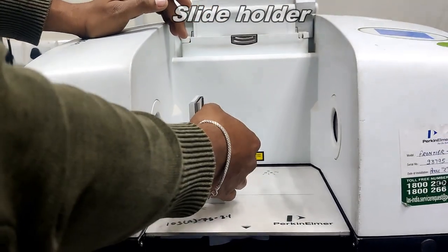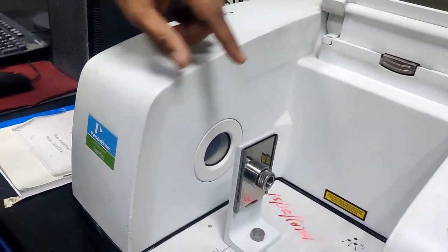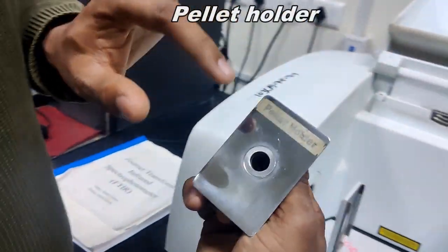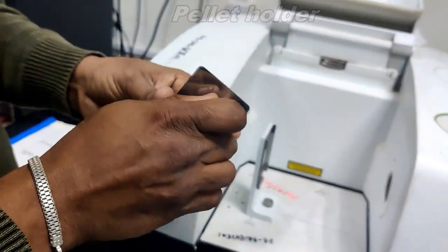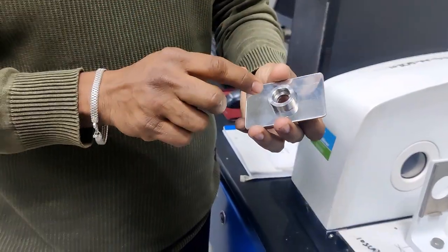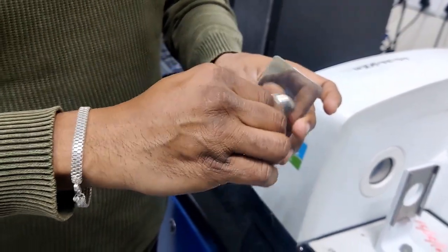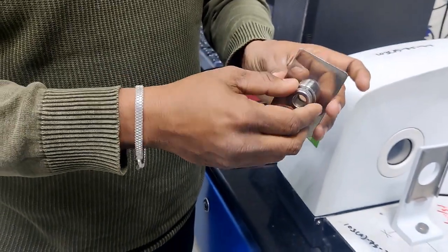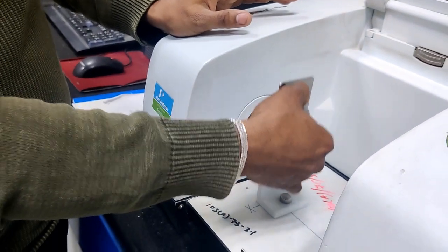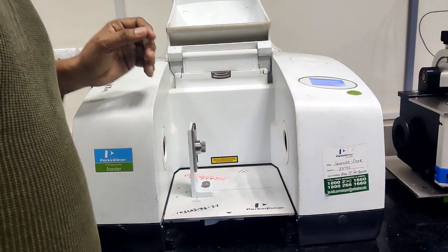Okay, so this is the KBr mode. For KBr mode, we have the FTIR slide prepared sample pellet in a pellet holder. This is the pellet holder. We will keep the prepared sample pellet inside this one. Then after that, we close it like this, slightly tight, and keep it inside the slide holder like this. So this is about KBr mode.